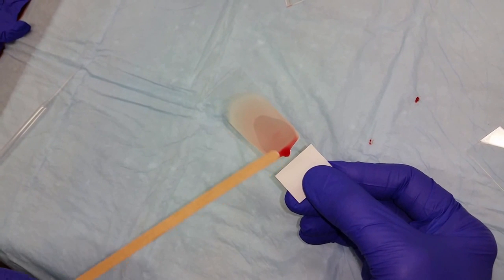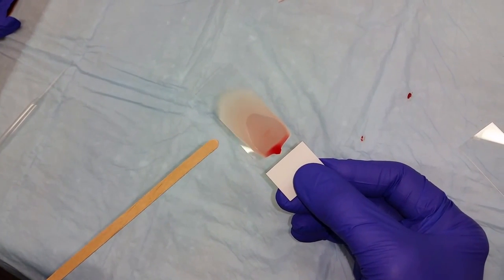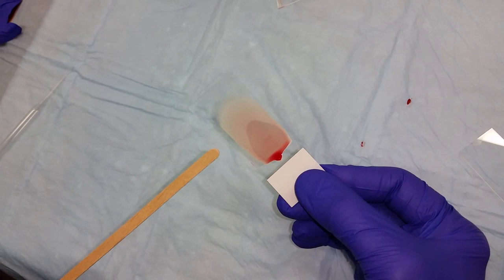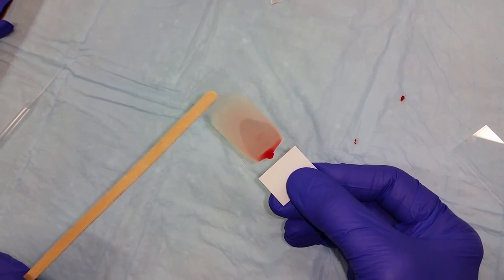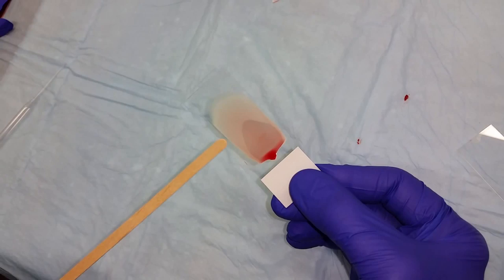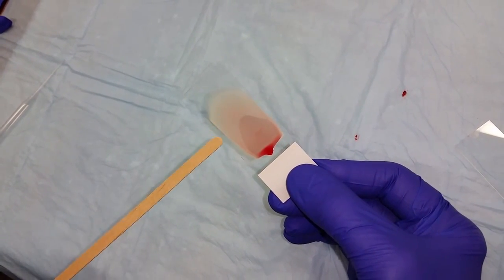And then after it's stained, the area of the slide that you want to look at to best judge blood morphology is just a bit proximal to the thin area of the feathered edge, right about here. This area here.